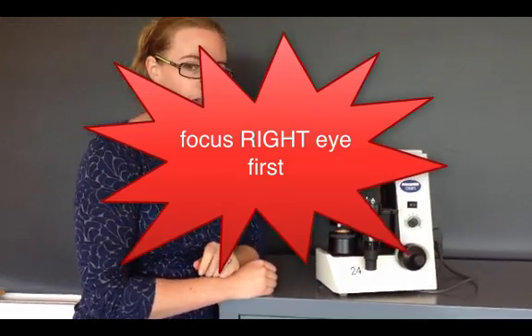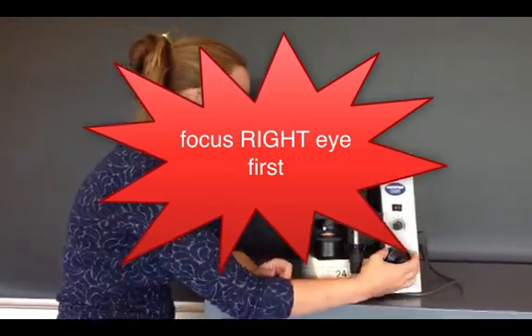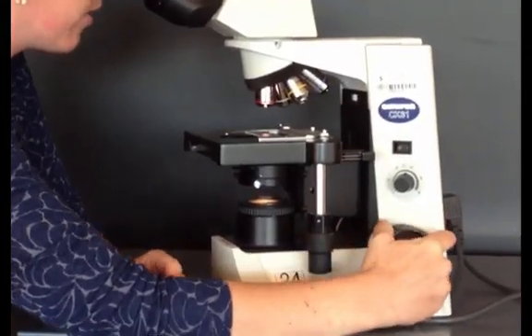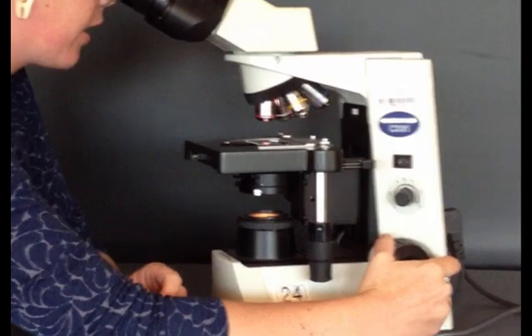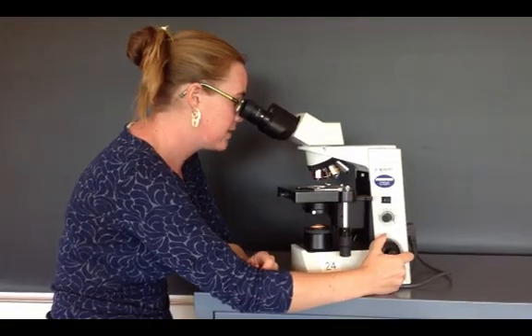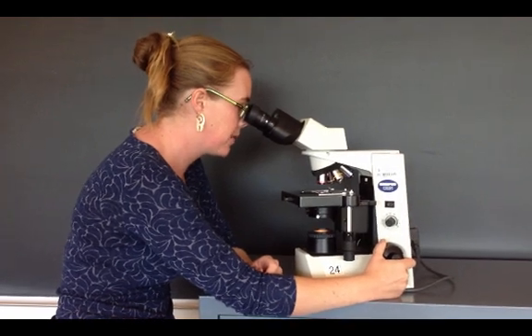However, you're going to close your left eye as you do this. So only look through the microscope with your right eye. Then slowly bring the stage up until it looks in focus through your right eye. So now I can see some small dots of my specimen.